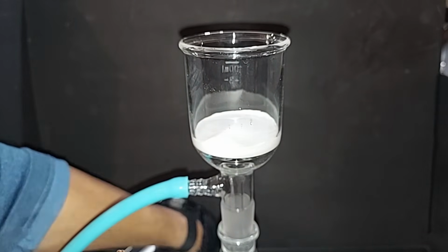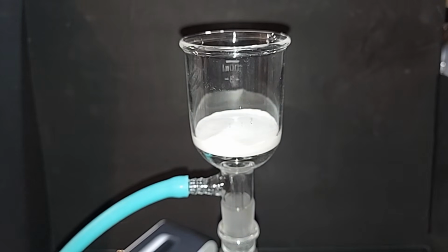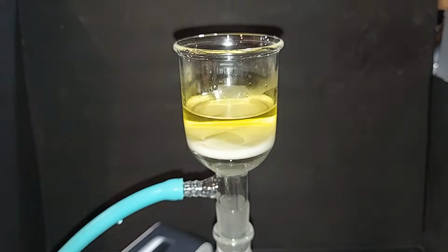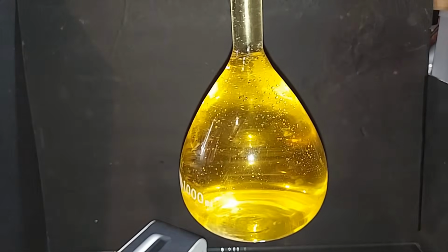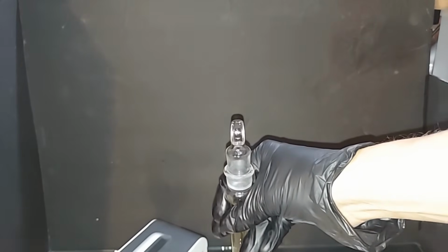All right, turning on the vacuum filtration. Letting all the iron oxalate settle should help this filtration here, because we're just decanting solution off the top. We just finished filtering the first just over a liter of sulfuric acid, very weak, of course, and of course this needs to be boiled down and distilled, but the rest of it I'm not going to bore you with. I will video when I actually start filtering out the iron oxalate.